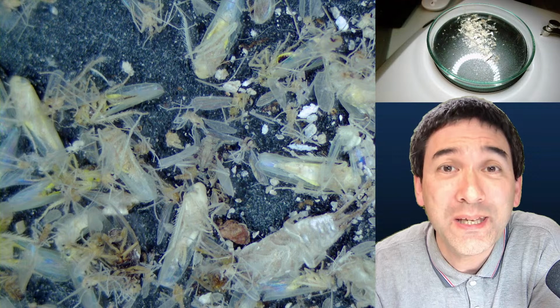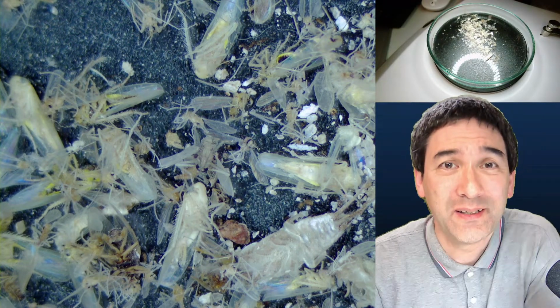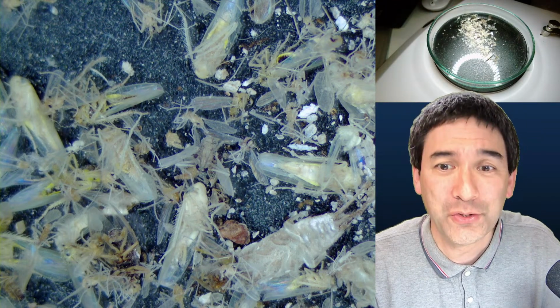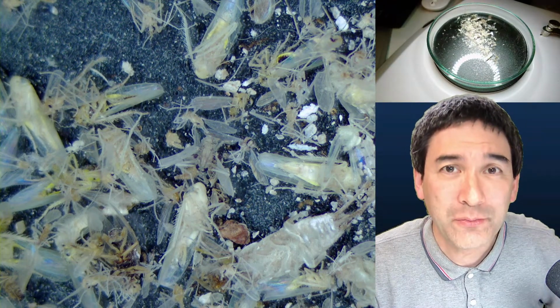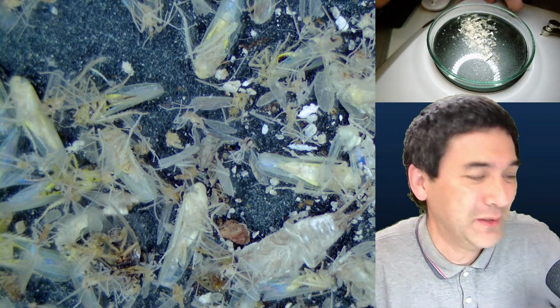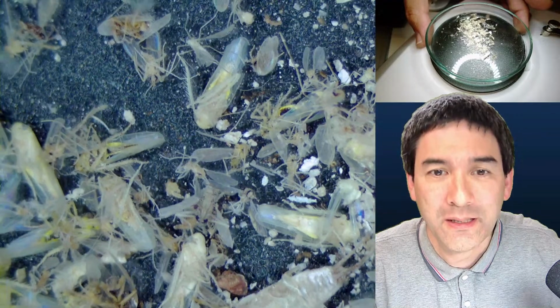Today I want to look at a few insects under the microscope. And you can already see that the setup here has changed around a little bit. I've got now a camera also for my stereo microscope, so you can see what's happening on the stage of the stereo microscope, and over here also a view under the stereo microscope as well.